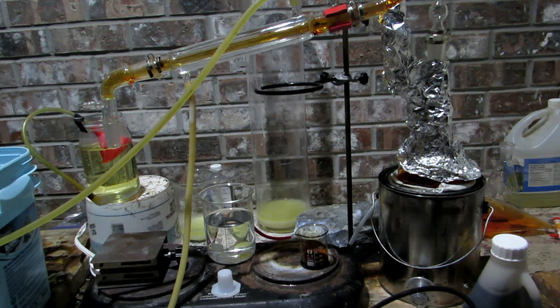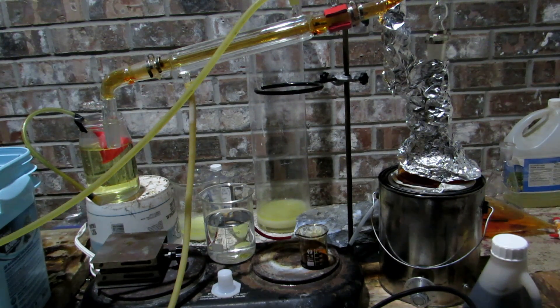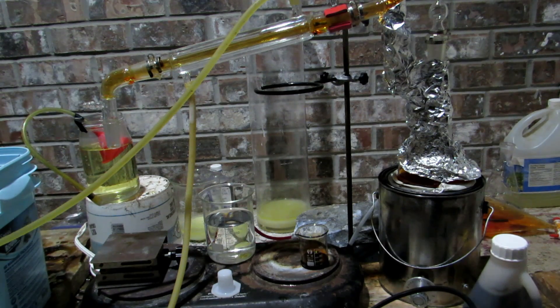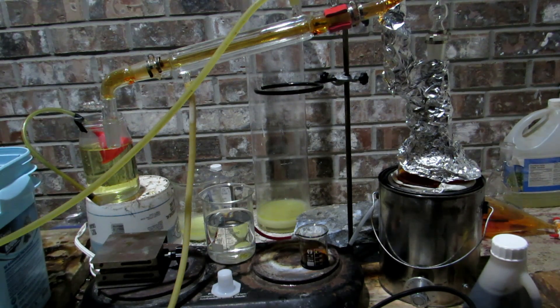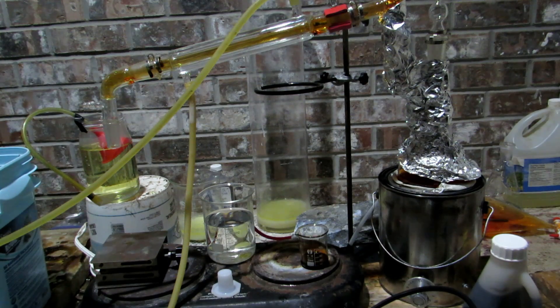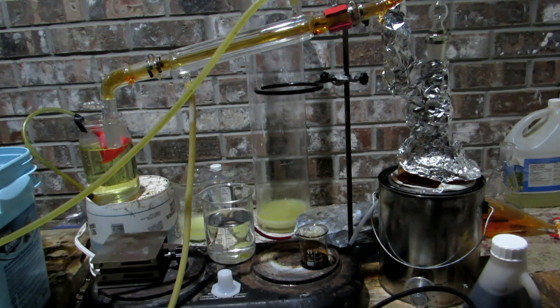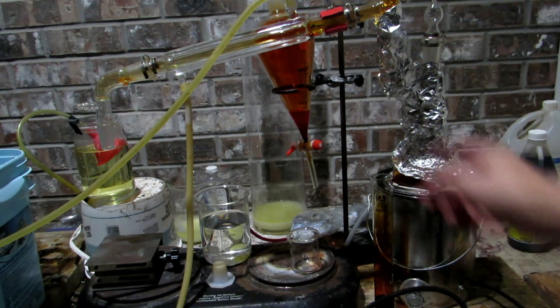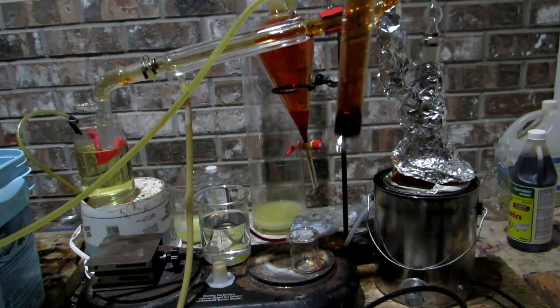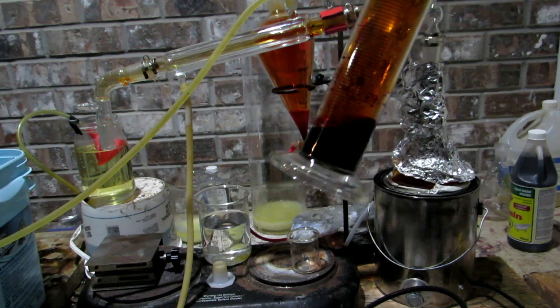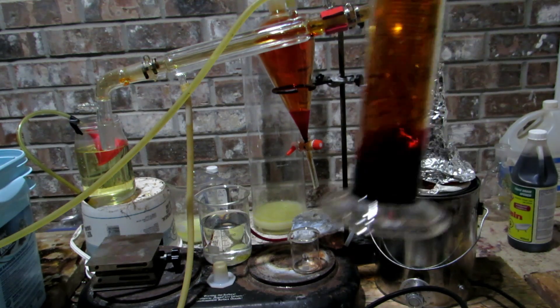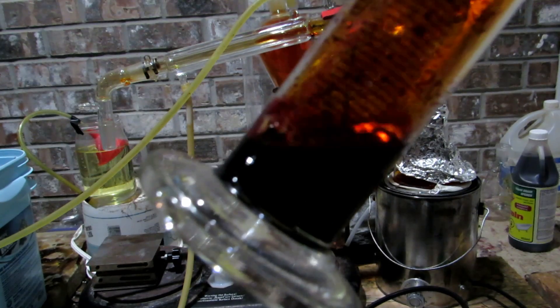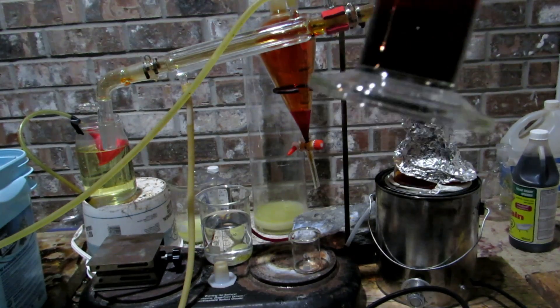However if you have more dirty sulfuric acid you might want to consider distilling it first. We're going to add that back into the separatory funnel, add about probably 20 milliliters of sulfuric acid on top and shake it around with frequent venting so we can hopefully pull out any remaining water. After separating it out you can see the sulfuric acid layer on top and a nice very pure bromine product. It's absolutely gorgeous, a beautiful color of bromine.